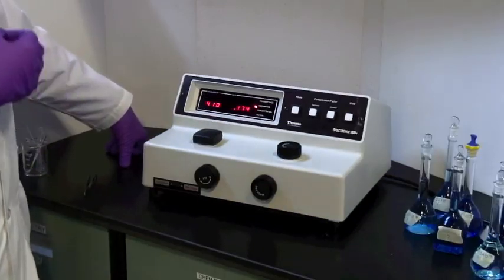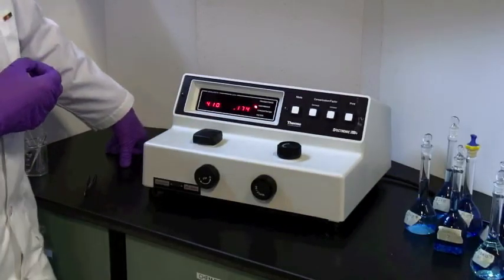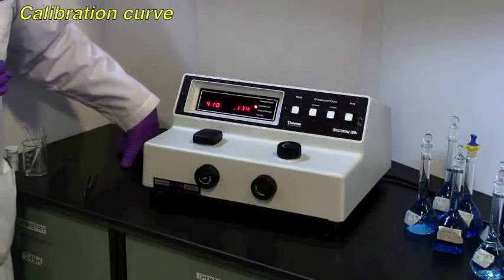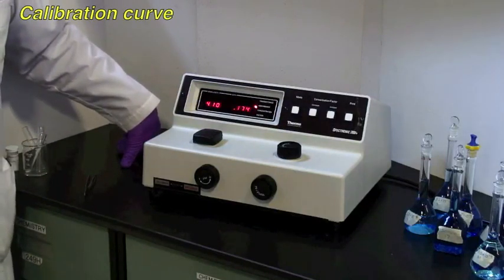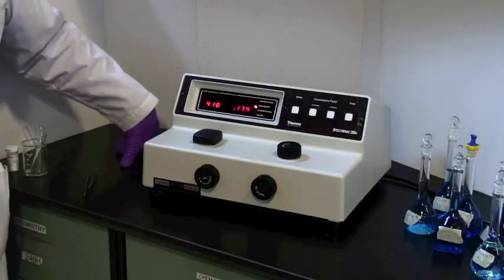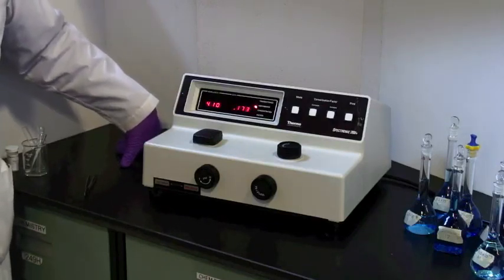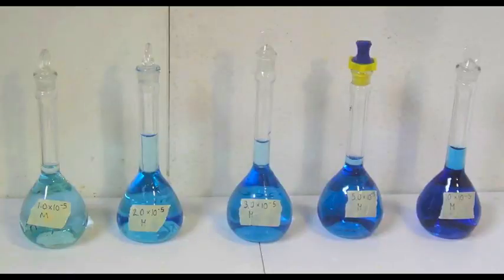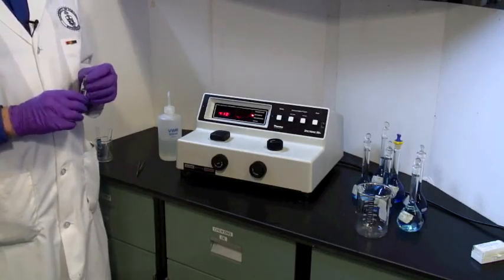Once you have chosen lambda max, and I think we will actually leave it at 410, you are now ready to construct a calibration curve, and read your known and your unknown solutions. Now, this part of the experiment is quite quick. It's a good idea to have all of your solutions ready to go, and then you can read them in rapid succession, bang, bang, bang.